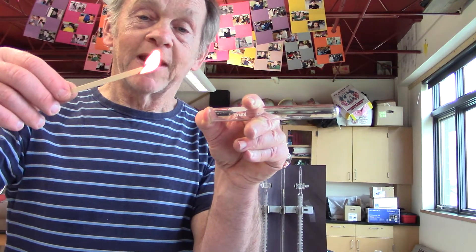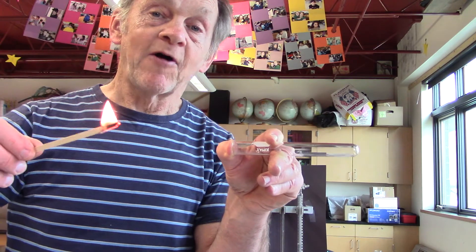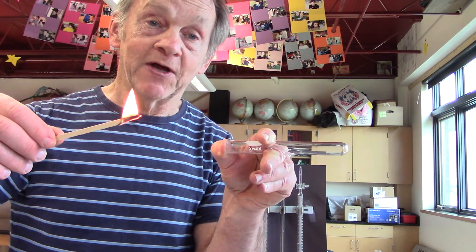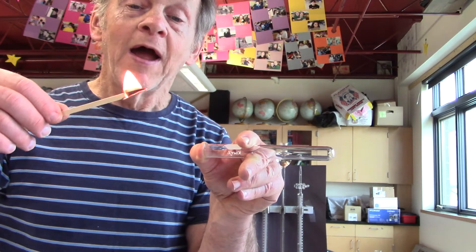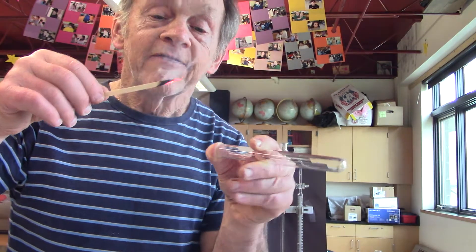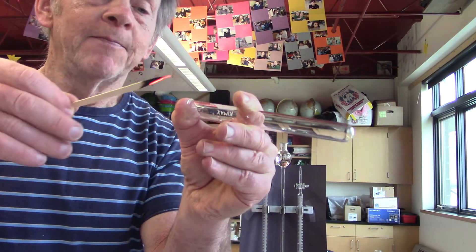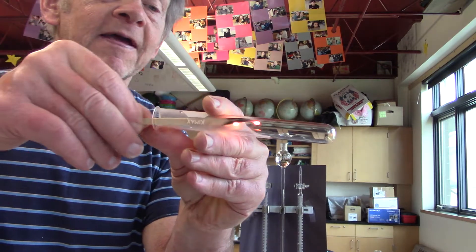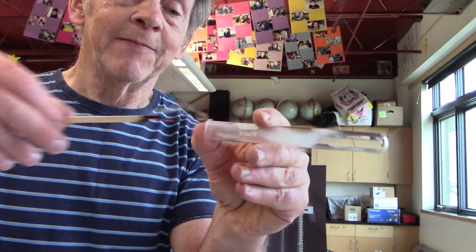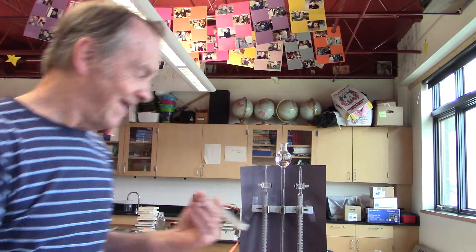And I've got a flame here but I'm going to blow it out because what we know is oxygen reacts with stuff to burn. And so I'm thinking if I blow this out and then put it in there, it will reignite into a flame. And hopefully you saw that because that's the whole reason that I'm back here today redoing it.